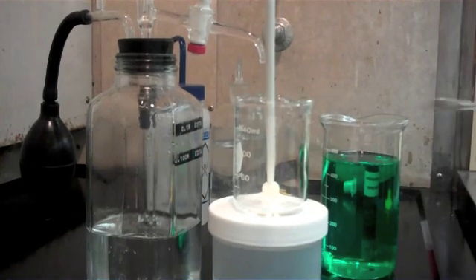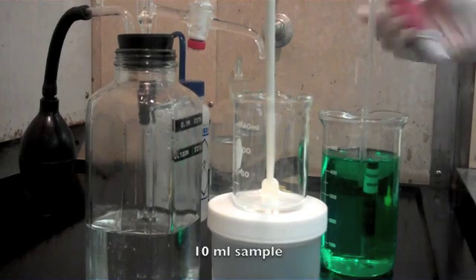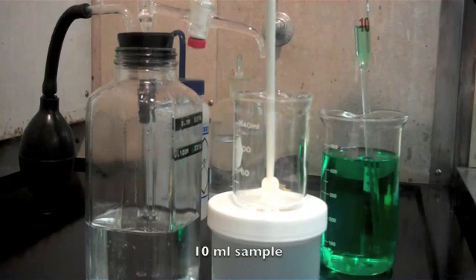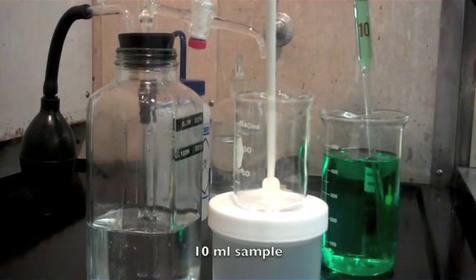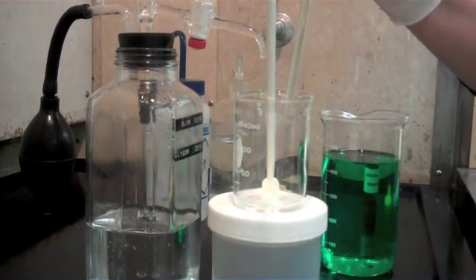Today we're going to be titrating nickel in an electroless nickel plating bath and I'm going to use a 10 mil pipette to take my sample. The pipette is going to be a much more accurate way of measuring a sample and we're going to put this into a clean beaker.